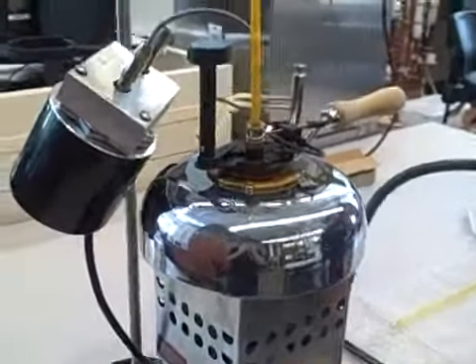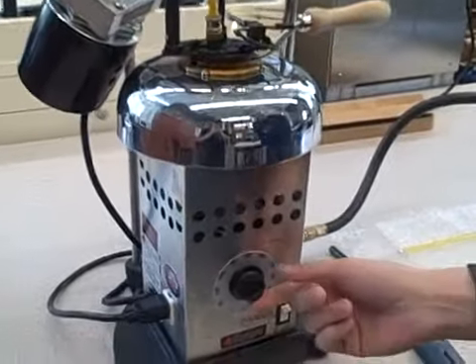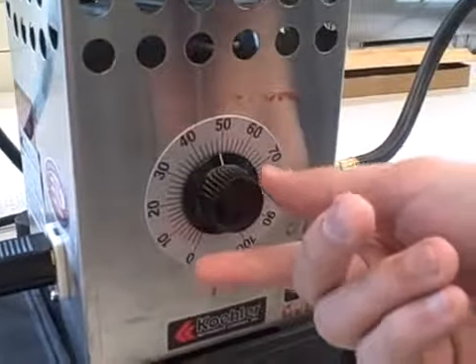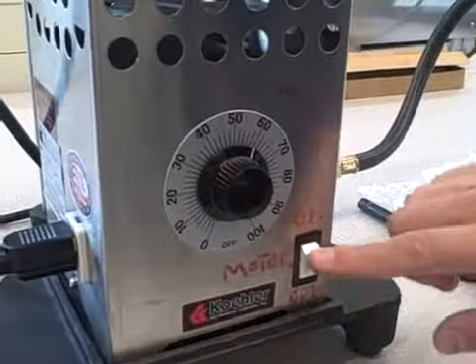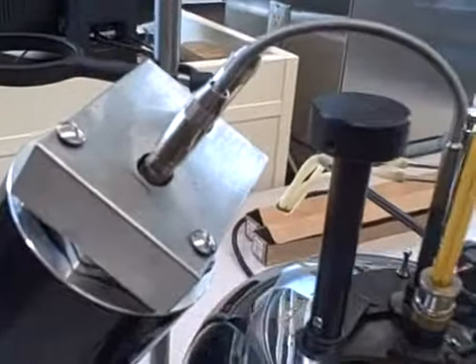Just about the size of a little bead. Then you set the heat supply of the stove. I usually start it between 50 and 70 — I'll set it to 60 right now. Then you start the stirring device to help stir the lamp oil and help heat it up.